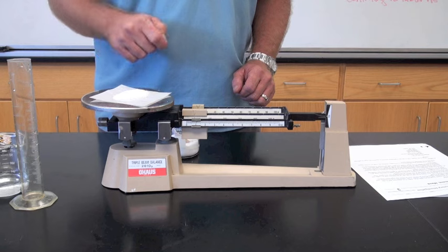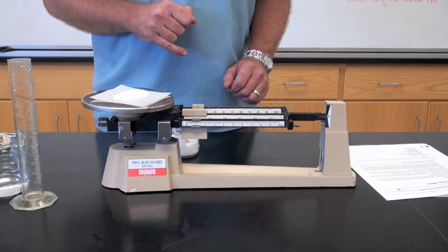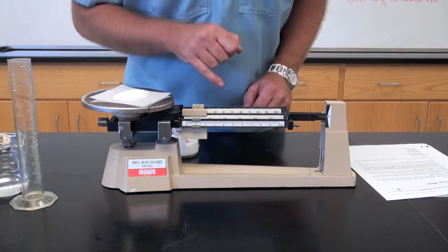I know that the weighing paper was one gram. The chemical is 10 grams. That makes 11 grams total.